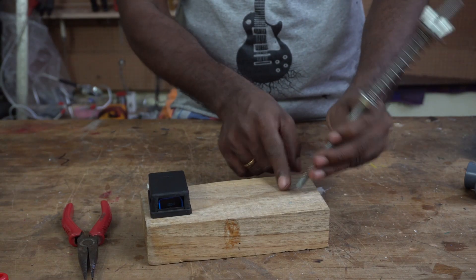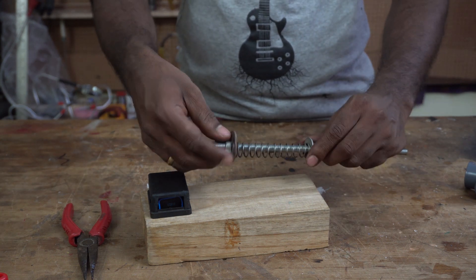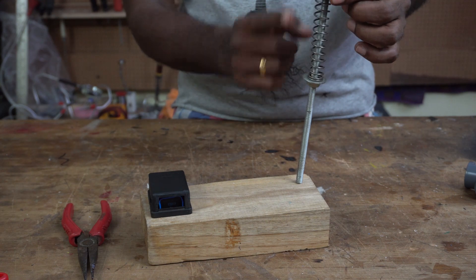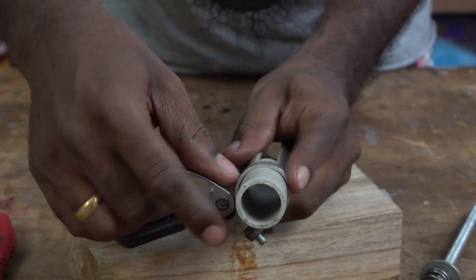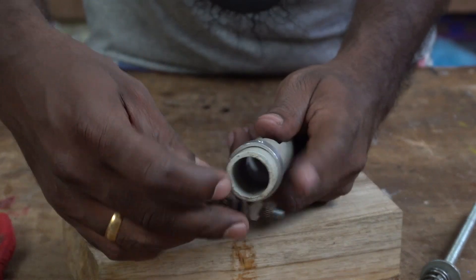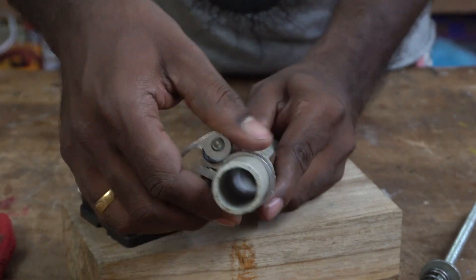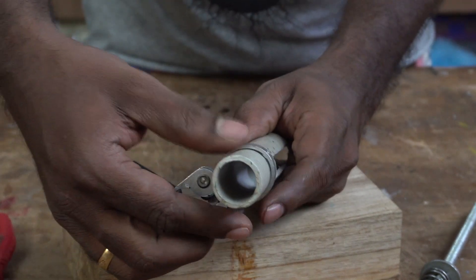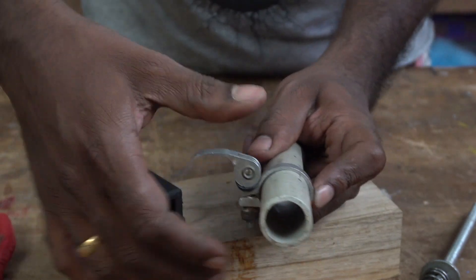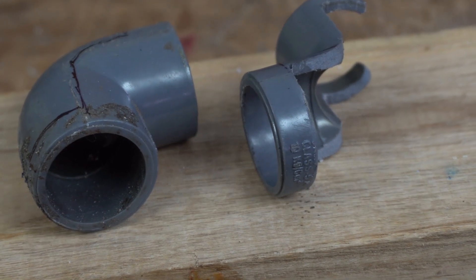This is a good choice but I thought of another plan. By using a long threaded rod with some springs, I could easily adjust the height and get precise focus. But I found another easy solution — I found these tube clamps which had a pre-drilled hole in the center. It is almost like a quick release function. All you have to do is open the latch, slide it up and down, and lock it at the desired position and it stays that way. The lens holder is nothing but an elbow connector with some parts removed.